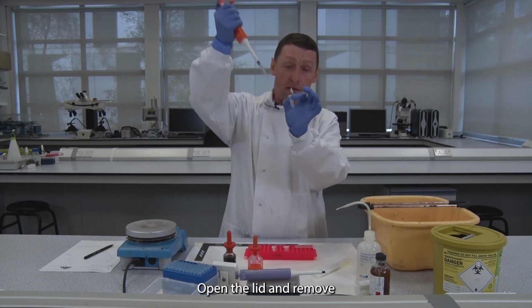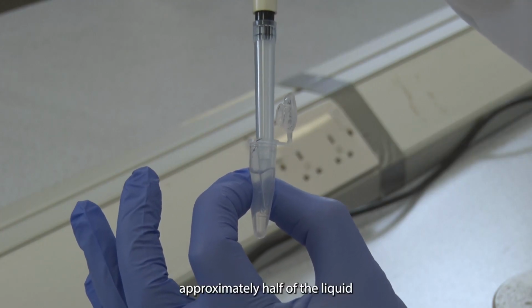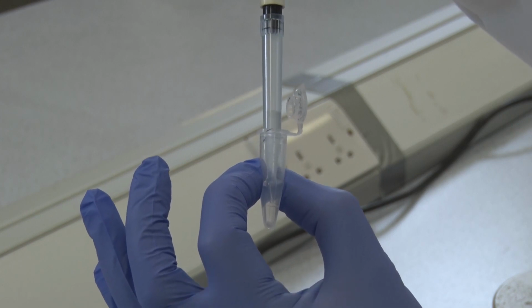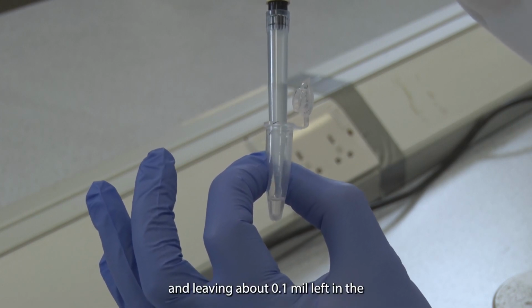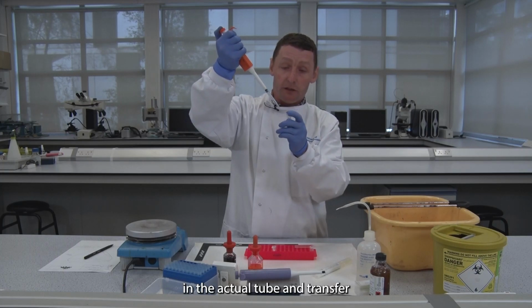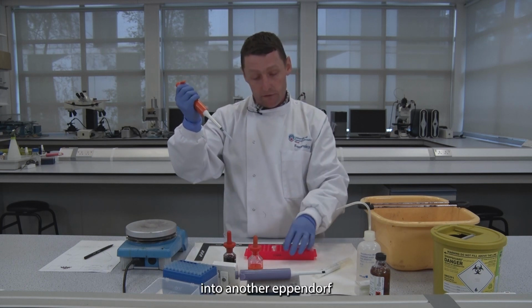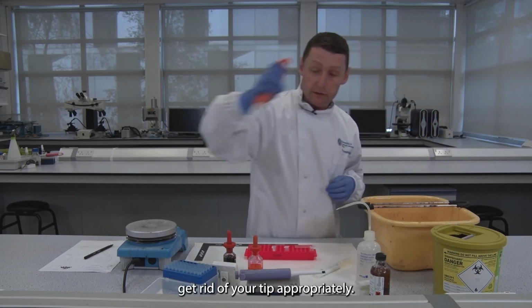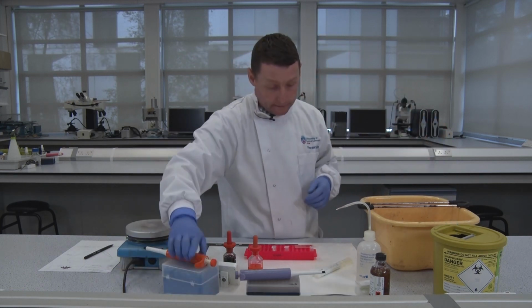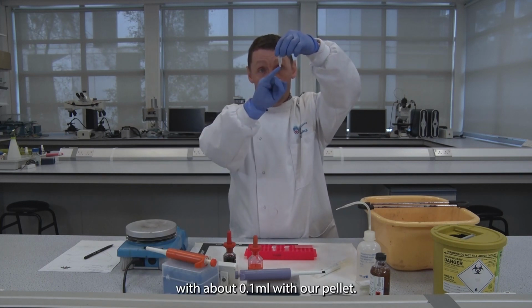Open the lid and remove approximately half of the liquid, leaving about 0.1 ml left in the actual tube, and transfer it into another Eppendorf. Get rid of your tips appropriately. So now we're left with about 0.1 ml with our pellet.